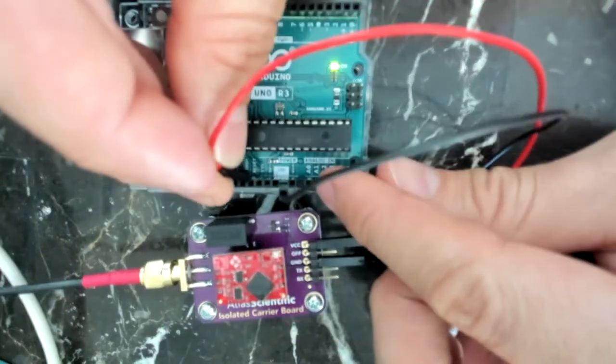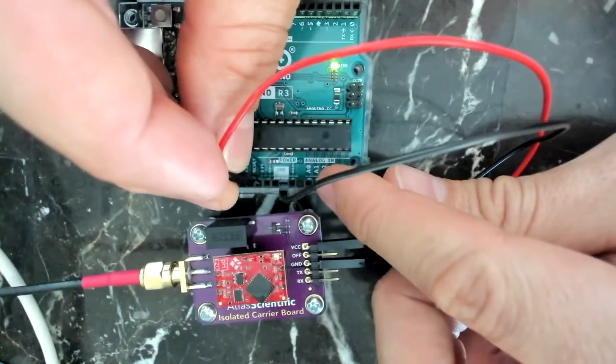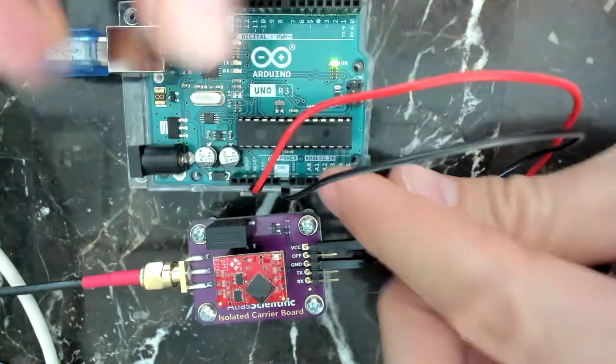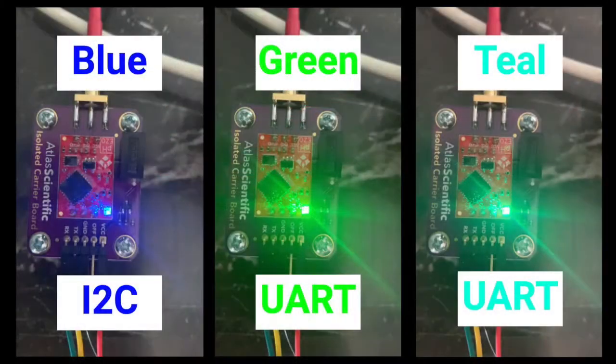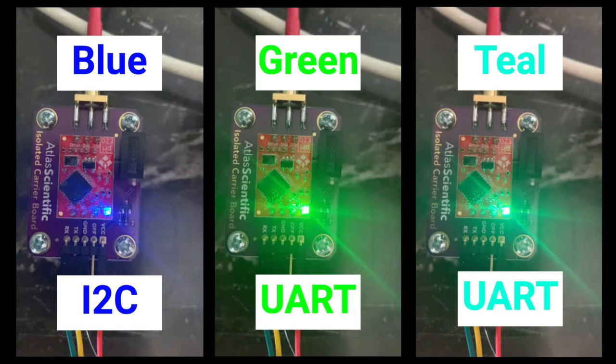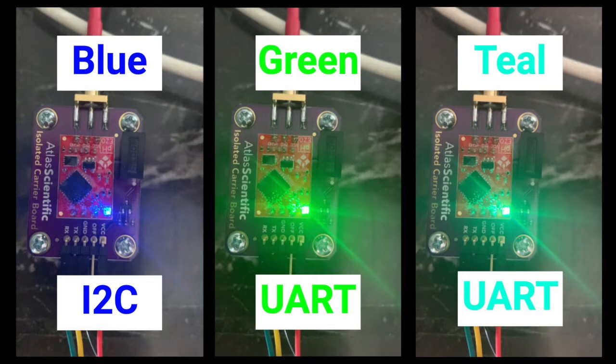Your voltage in can be either 3.3 or 5. I'll use 3.3. If you plug yours in and you see a very bright blue, you're in I2C mode. If you can't tell what the color is, or it's kind of a combo of blue and green, you're in UART.